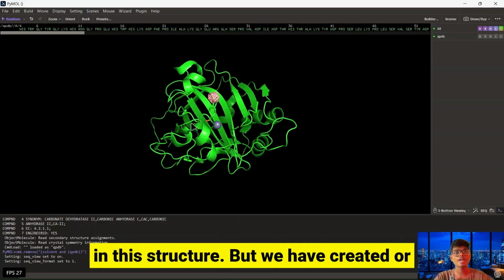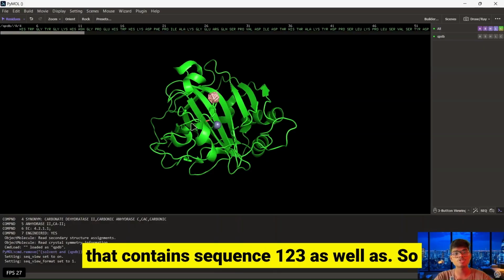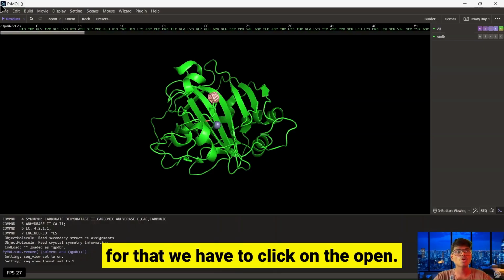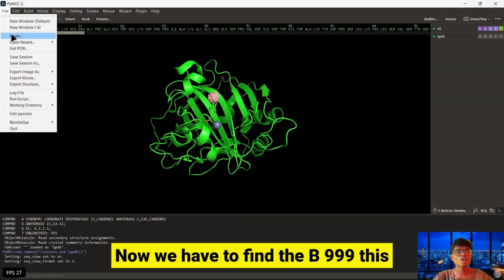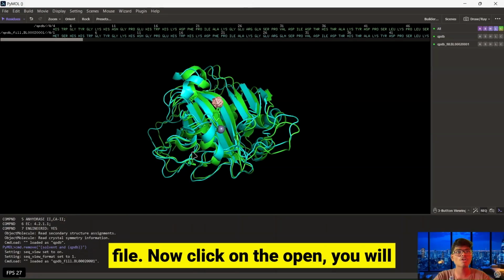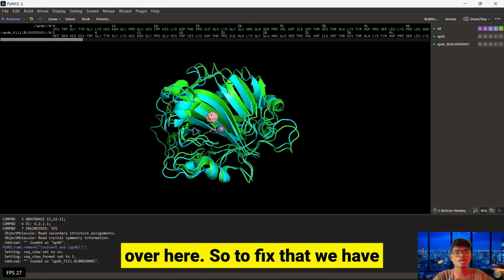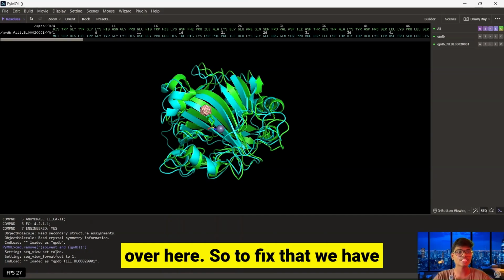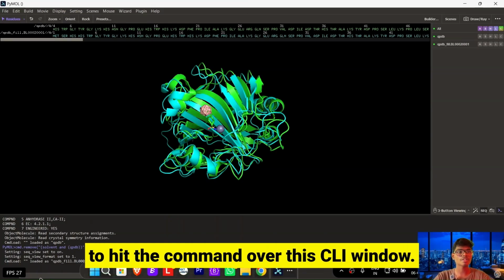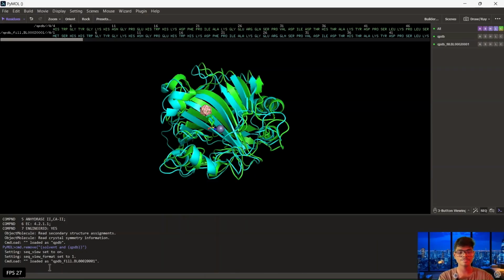But we have constructed a protein structure that contains residues 1, 2, 3 as well. So for that we have to click on open. Now we have to find the B999 file. Now click on open. You will find there is a small mess over here. To fix that, we have to enter a command in this PyMol window. For that we have to use align.